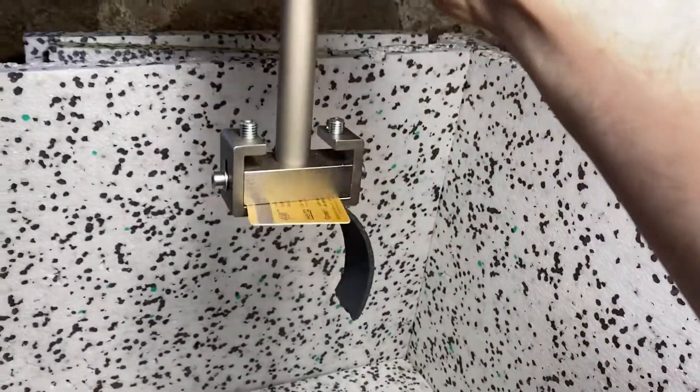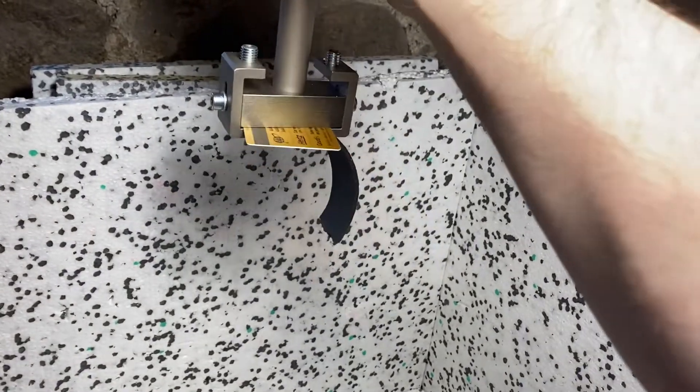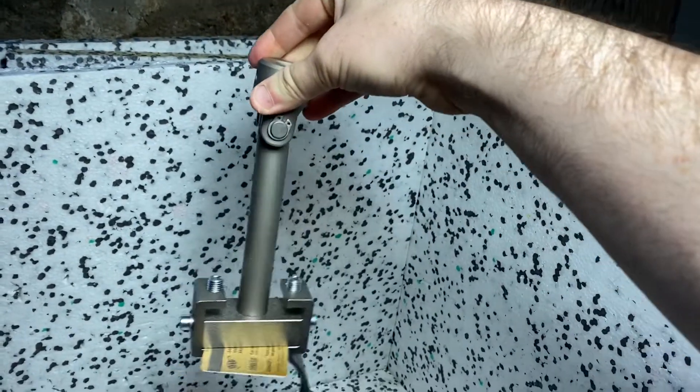Fix the card there — looks a little something like that. So we would have a metal substrate and a piece of rubber, but just for demo this is what I have. And you can see the swivel joint there.